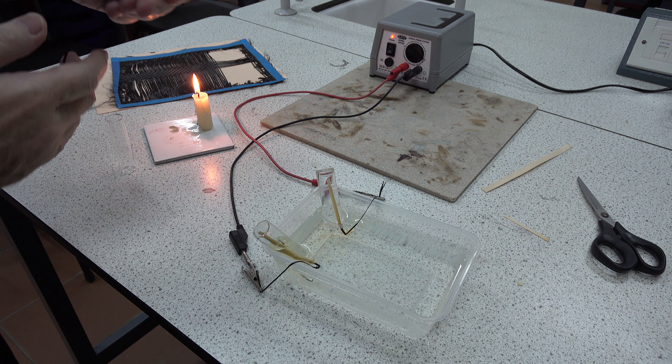That needs to dry. We can also secure the bottom end again with candle wax, and once that's dry we can then insert the tube — whether it's full of liquid or not — and use it in an electrolysis setup as shown here. You can see this wax is not quite dry there.